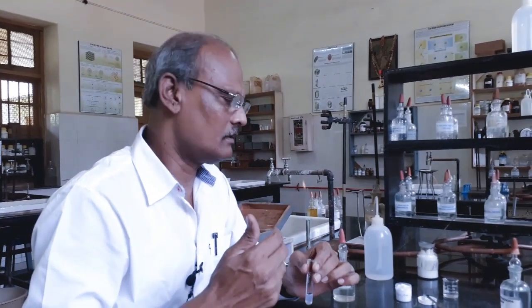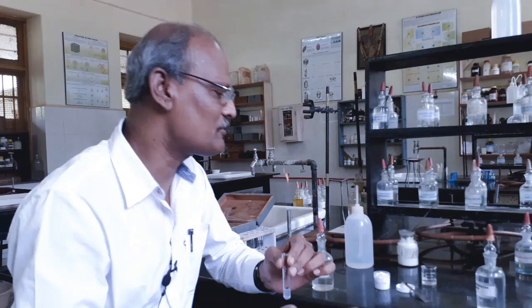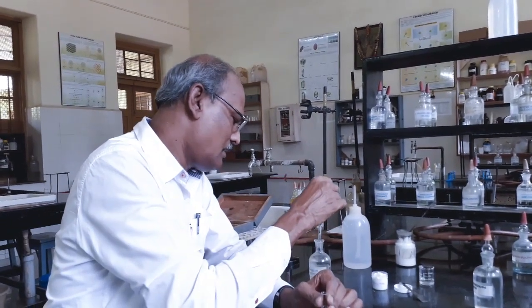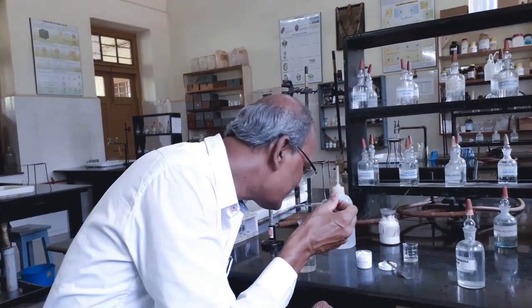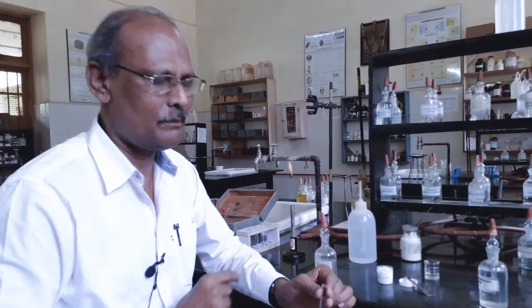We cannot explain how the pungent odor will be. You have to experience it. For that purpose, you just take the ammonium hydroxide bottle and inhale the odor of ammonia. Whatever odor you get, that is the pungent odor.